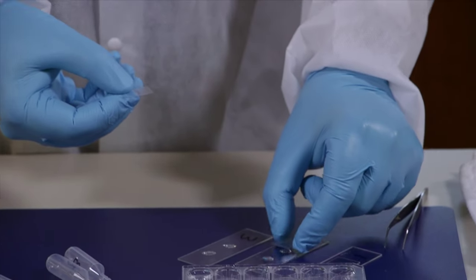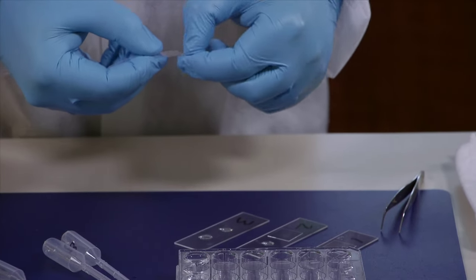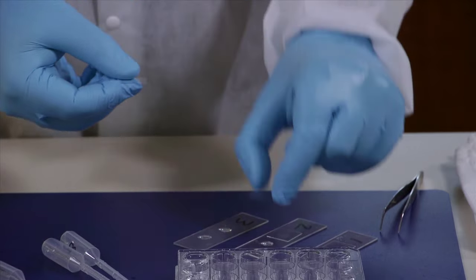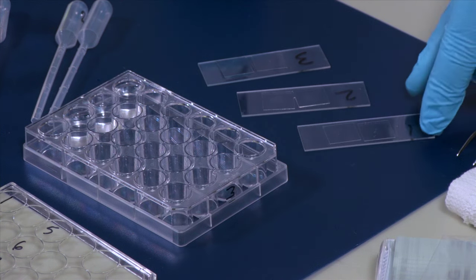And now we'll put a cover slip on each slide. Once you've got a cover slip on the slides we're ready to go look at these in the microscope.